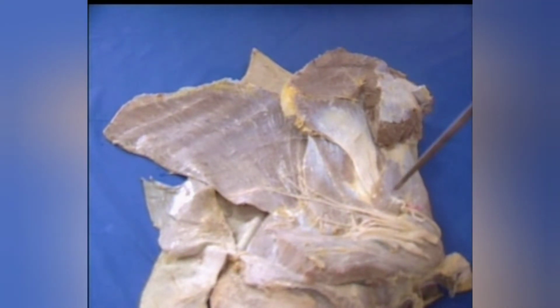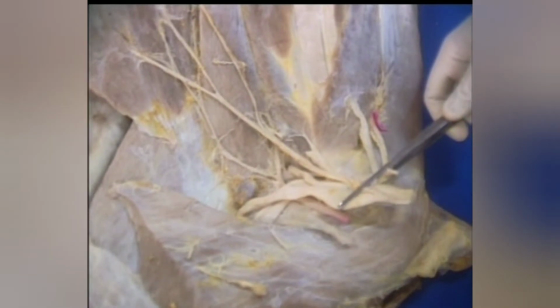Just clean the fascia without disturbing the branches of brachial plexus and brachial artery. This flat bundle of nerves on the medial aspect of the shoulder and arm is the brachial plexus. It is formed by the union of ventral primary branches of 6th, 7th and 8th cervical and 1st and 2nd thoracic spinal nerves. Nerves arising from this plexus supply the entire forelimb muscles and also part of the muscles on the lateral wall of the thorax.